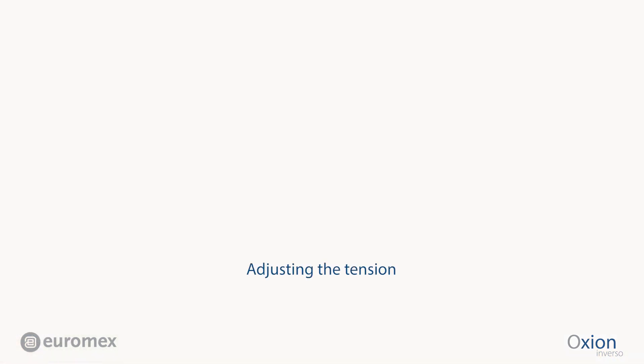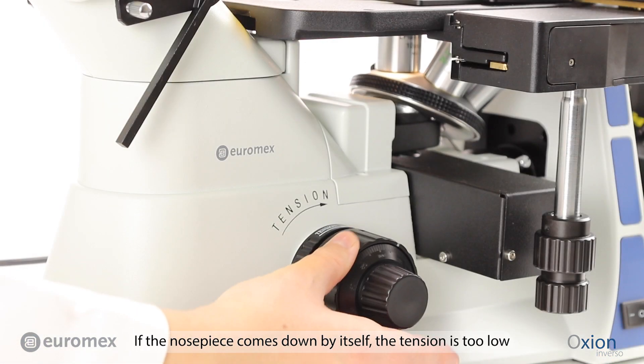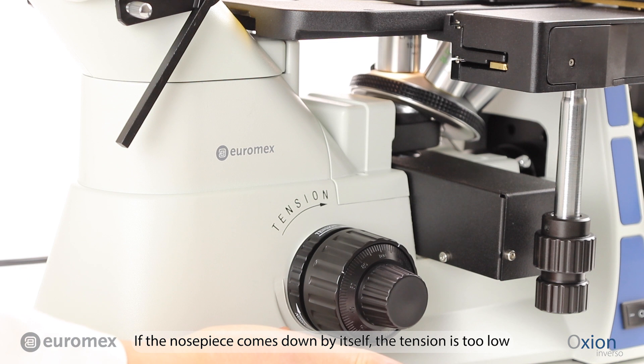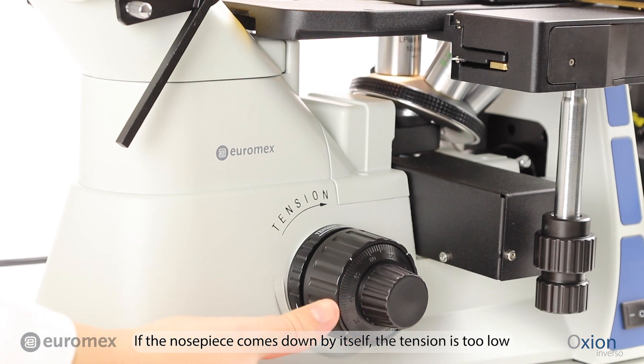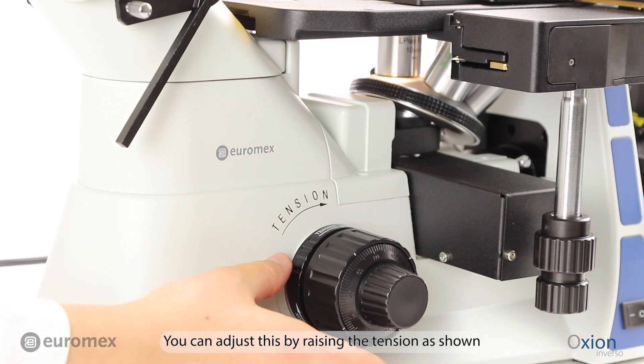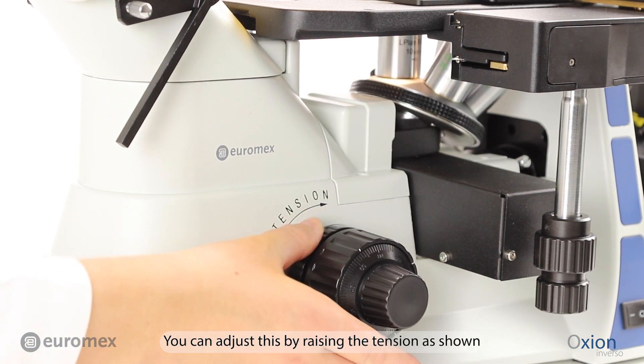Adjusting the Tension. If the nosepiece comes down by itself, the tension is too low. You can adjust this by raising the tension as shown.